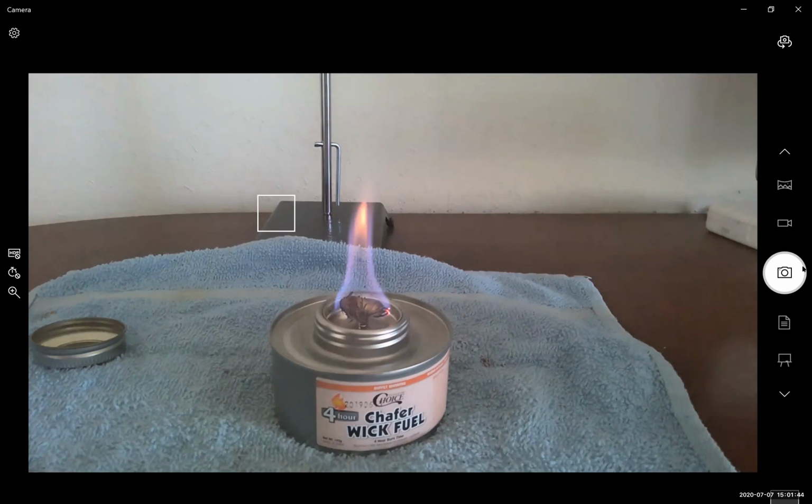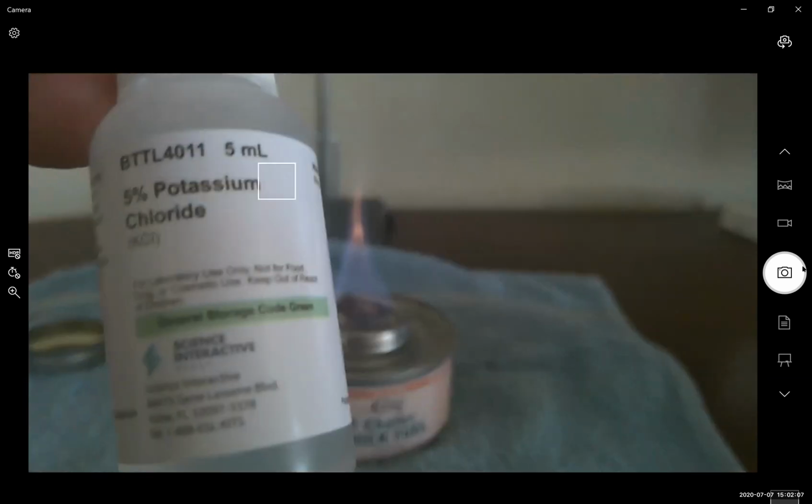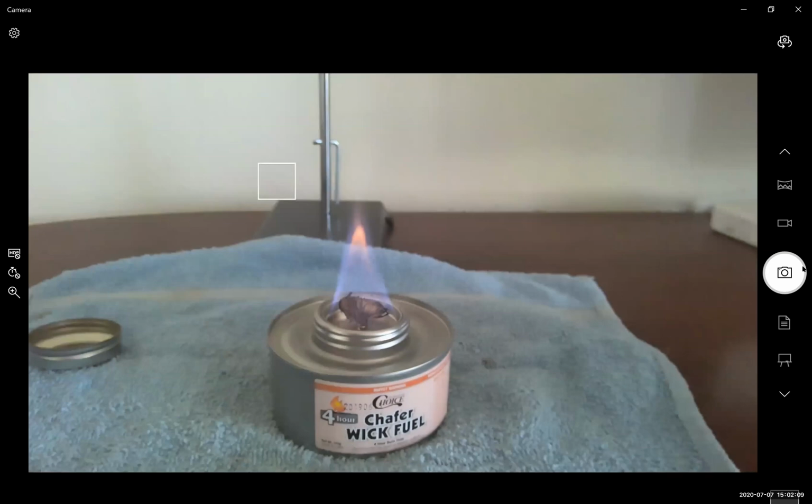Let's try potassium, since although it's hard to see, it's very different than any of the other colors. This is one where you really have to just try them multiple times just to check. We were looking at sodium chloride. Now let's look at potassium chloride and see if we can get a distinct color. So we have potassium chloride.